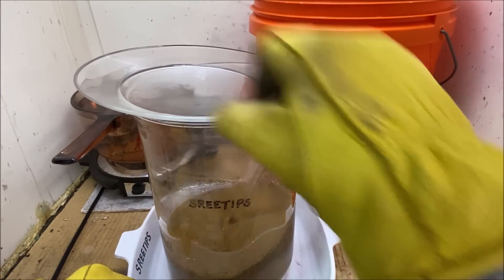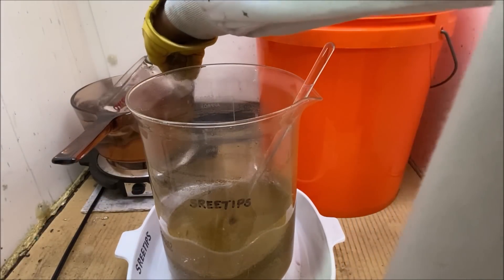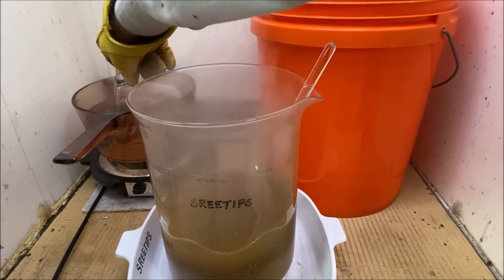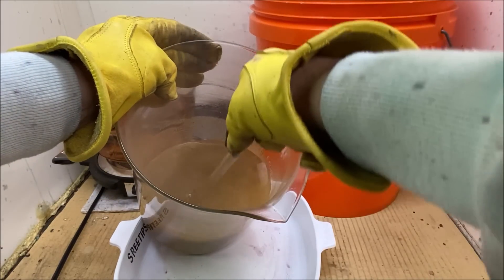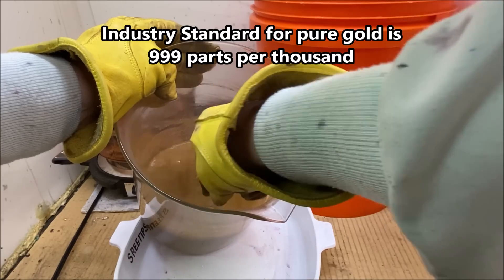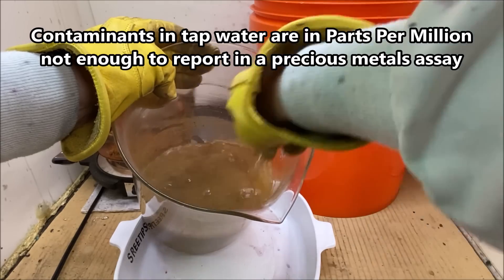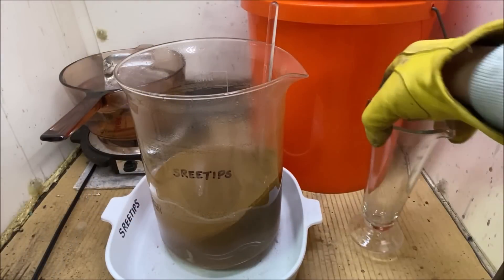I have the precipitated gold in this beaker. We're going to use boiling tap water to rinse the gold powder and get all the chemicals rinsed off. People are saying tap water will introduce contamination, and that is true — tap water does have contaminants — but those contaminants are measured in parts per million around here, and that's just not enough to register in a precious metals assay.